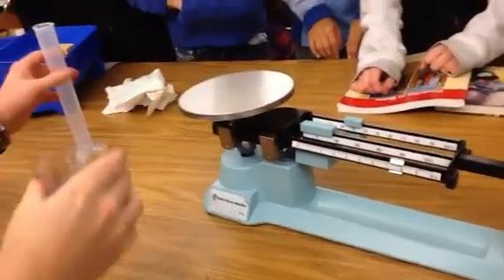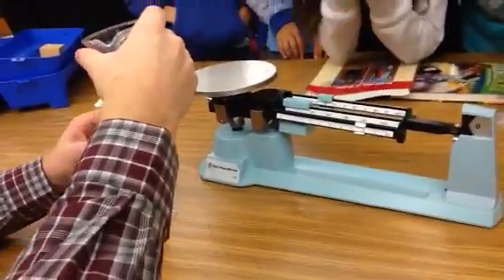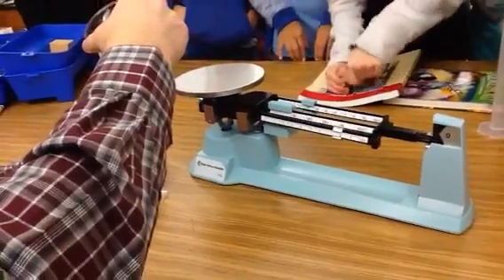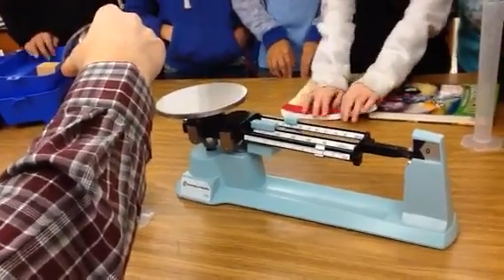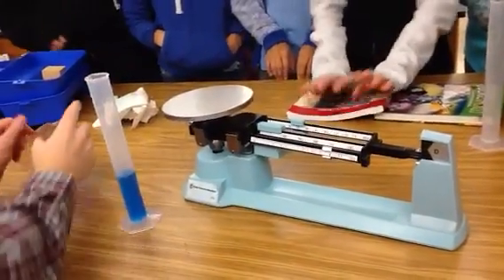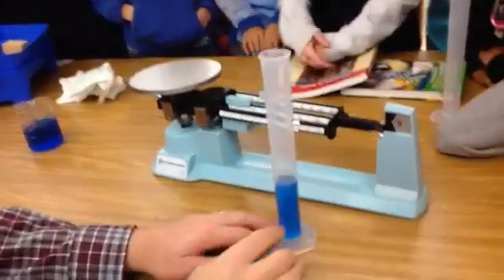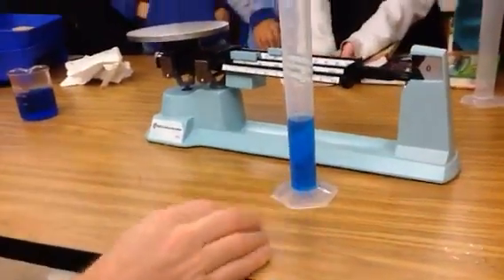And now we're going to pour the water in. Here's 40 milliliters. I'll go eye level and it's exactly 40, so we're good.